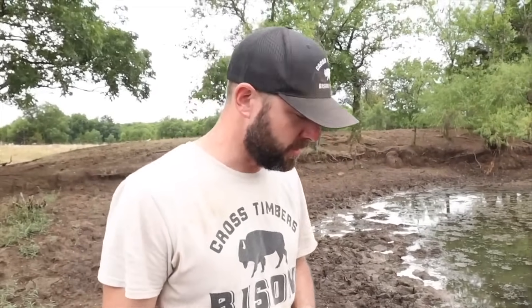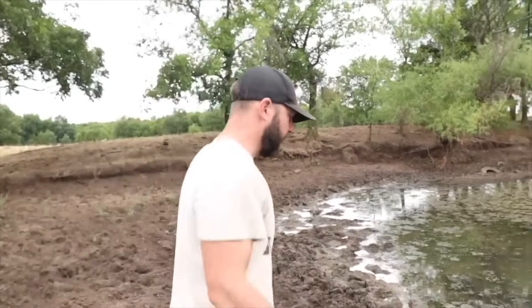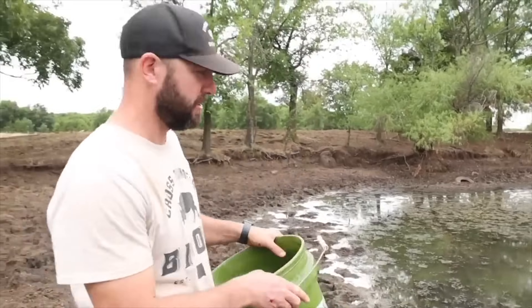Maya is having some water, so I guess that's a natural test right there. But what we're going to do is use this bucket — this is going to be a little more complex testing for water. It'll give us a yes or a no, a thumbs up or thumbs down. We're stepping back into the lab here of high school and college days.